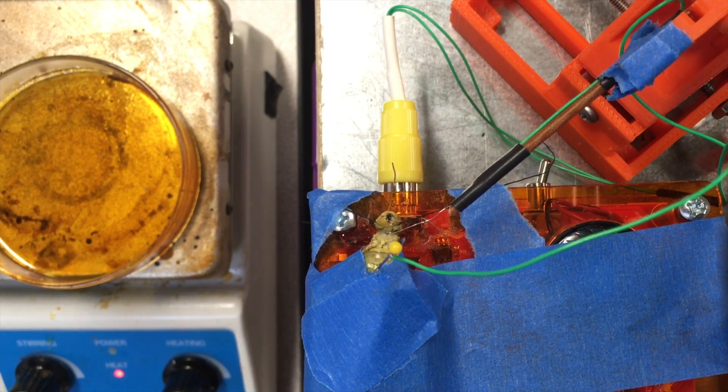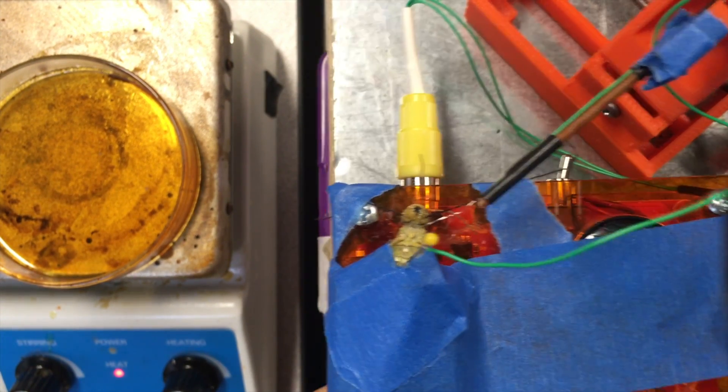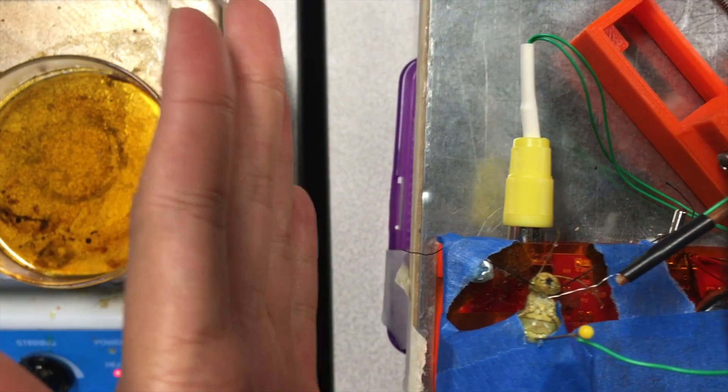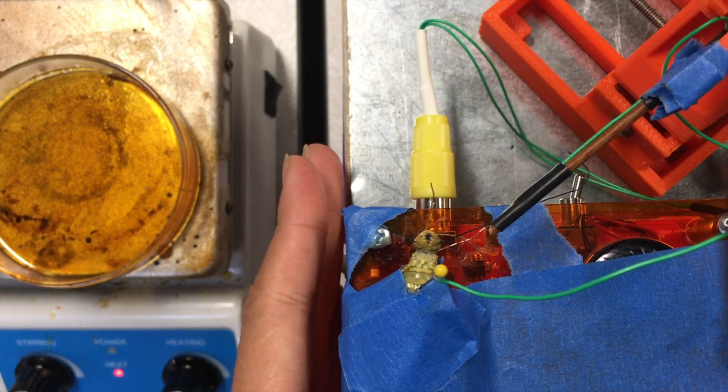Okay, just a few dabs and now the prep is done. Make sure that nothing is blocking the eye of the grasshopper. This is the eye where the visual stimulus will be shown.